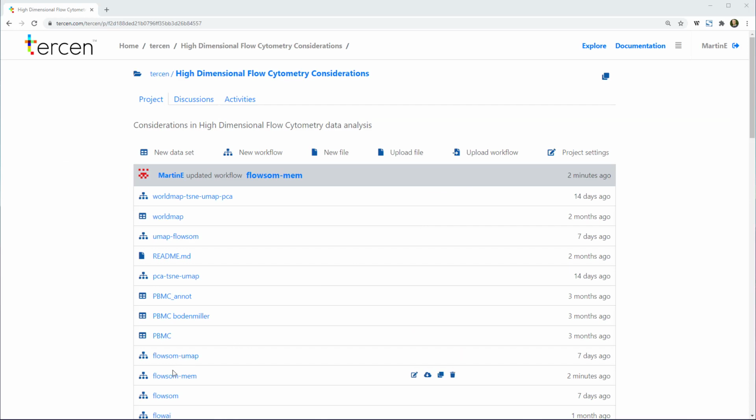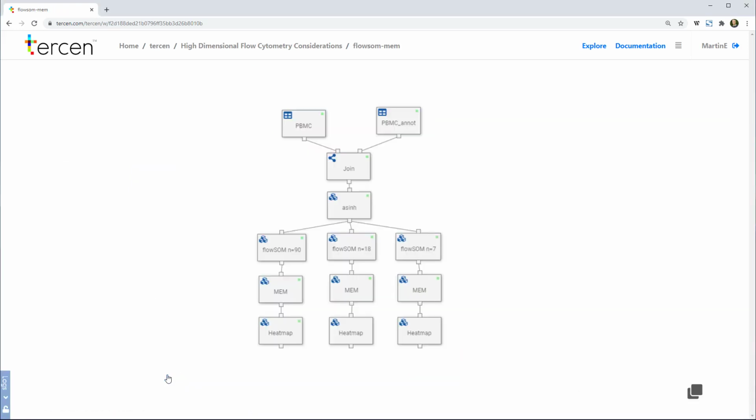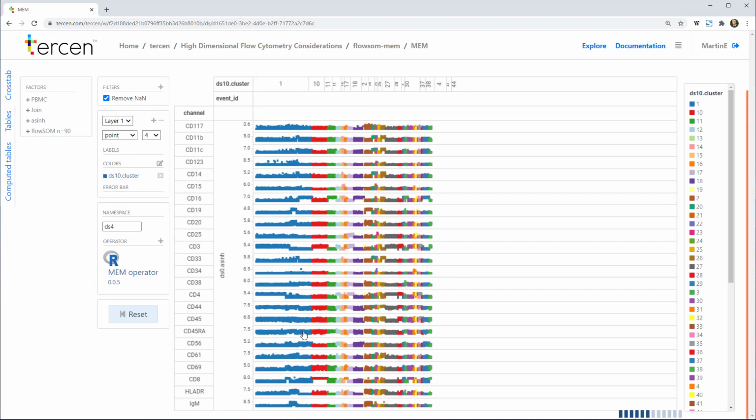Now, let me show you a workflow in Tercen which makes this process easy to do. You see, like in the last video, we've taken our PBMC dataset and performed the asinh transformation to make it ready for a flowSOM calculation. We started by doing flowSOM with 90 clusters. We picked this number because we know it is a lot higher than the number of populations we should expect to see in this sample. We call this overclustering, and at this stage, it's more important to cast the net wide rather than try to accurately predict anything. In the next step, we visualize the 90 clusters created by flowSOM.